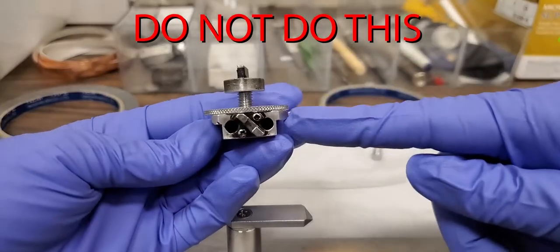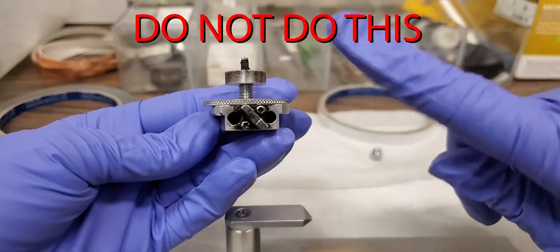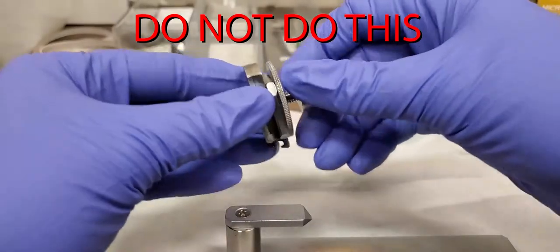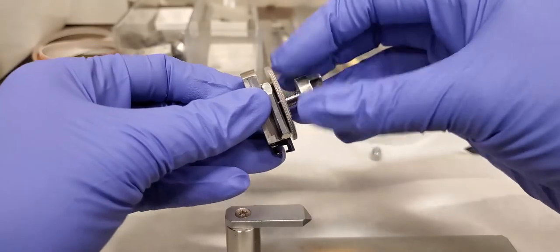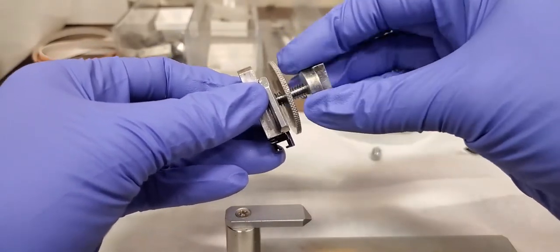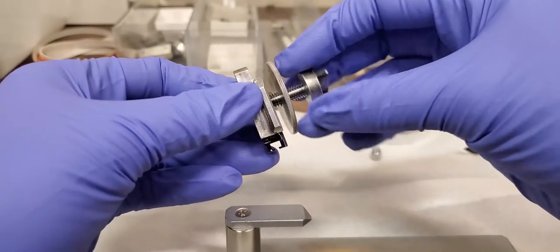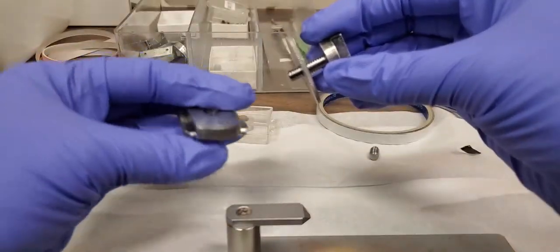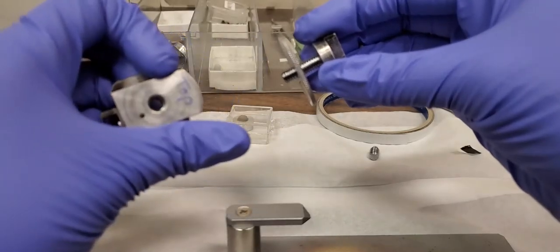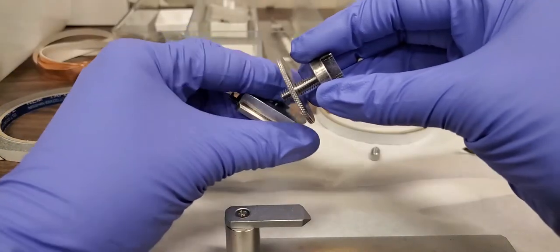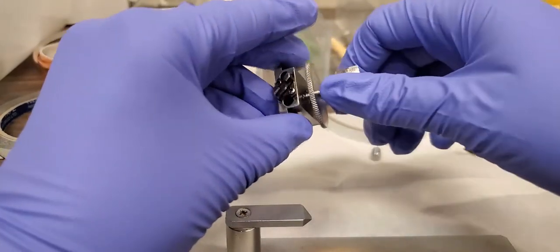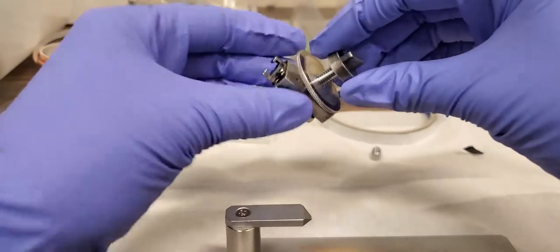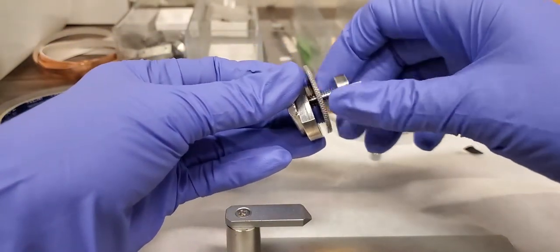So there are a couple of things you can do wrong when you try to set up your sample. As shown here, you can turn the base upside down and mount it the wrong way. Do not do this. There are pictures in front of the table. If you forget which way it goes, you can always check. As shown here, this is the proper way that the base should be mounted anytime you are preparing your sample.